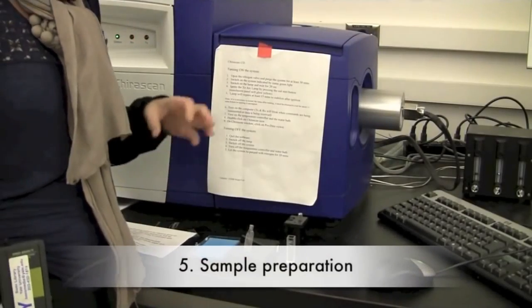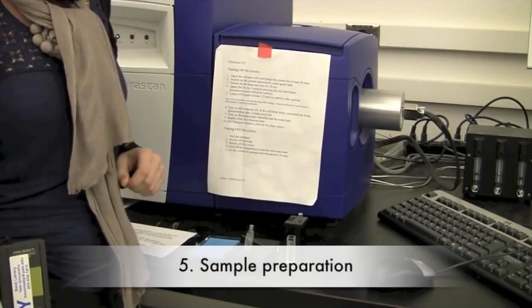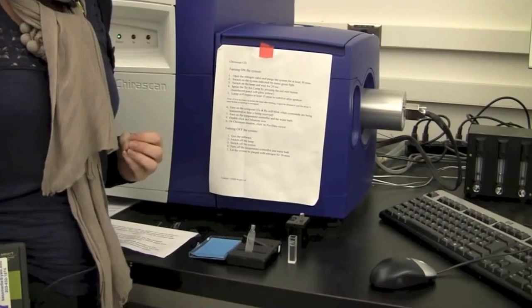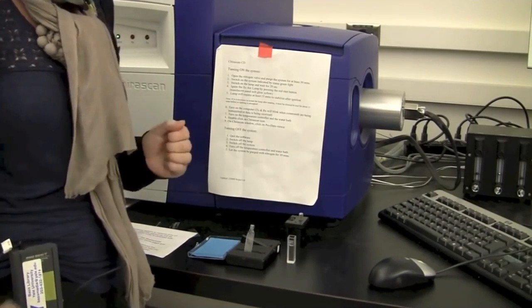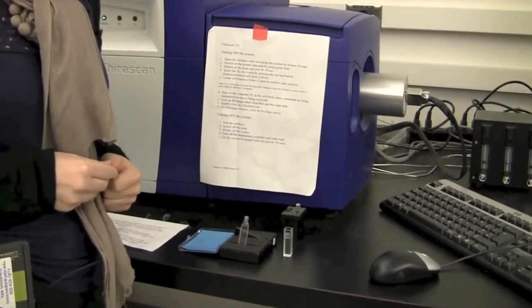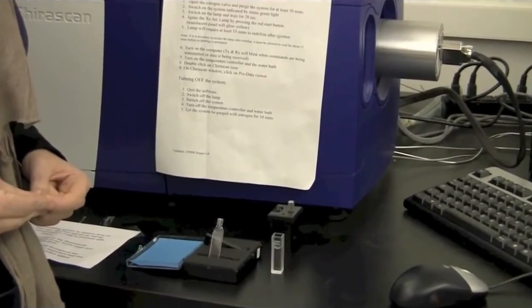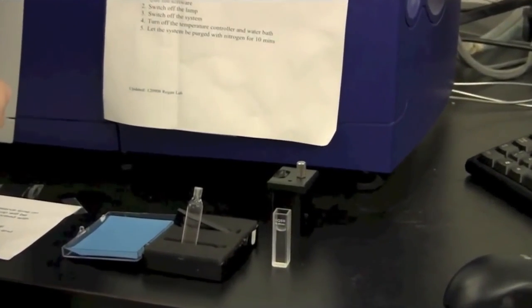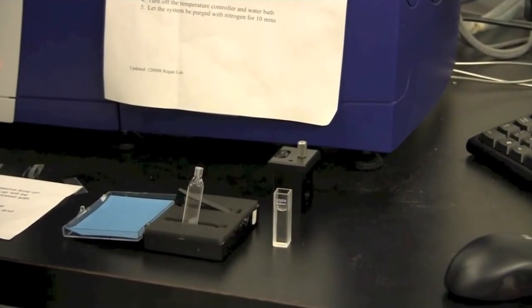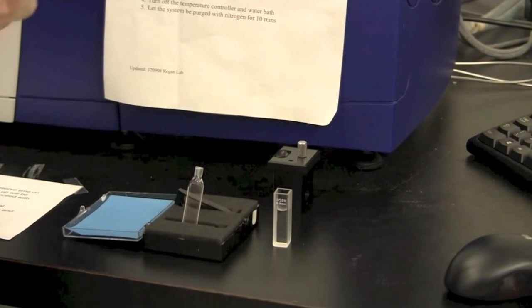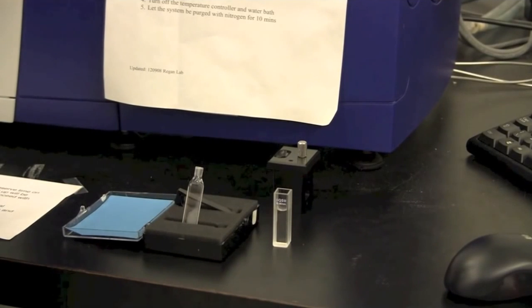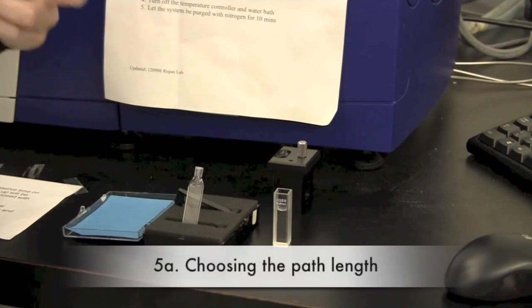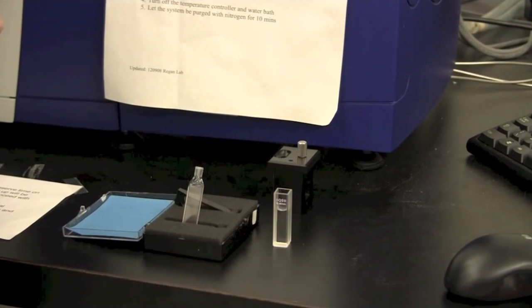Now I will go over a few things that you need to consider for when you are setting up your experiments. It is very important that you consider what path length to use, what concentration to use and what influence your buffer system has on your experimental setup. The first thing I will do is to very quickly demonstrate how the path length can influence how far in the UV you can go.